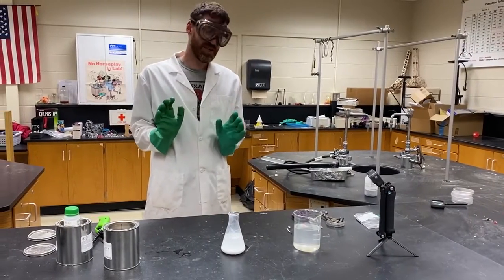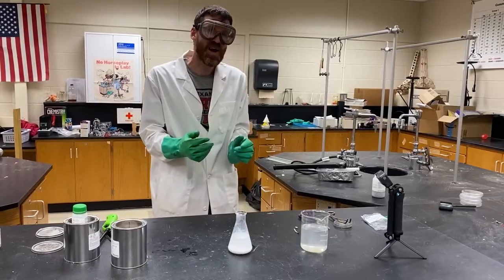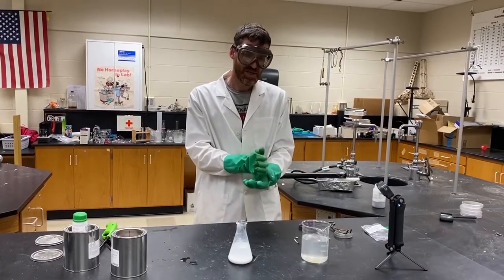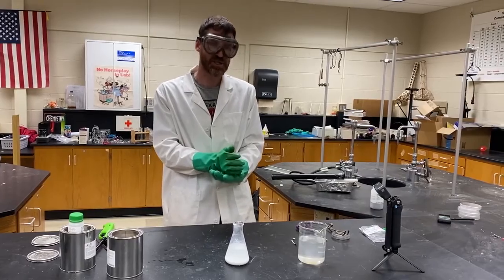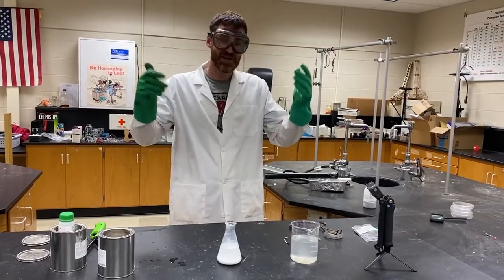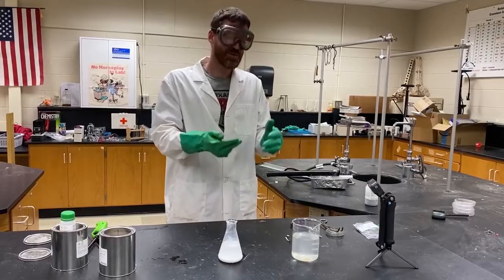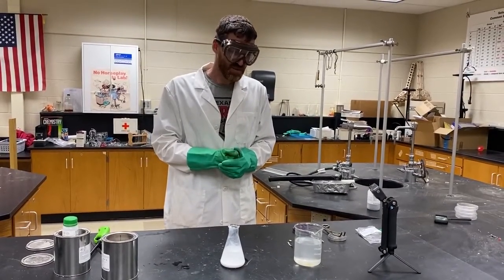It's pretty cool to think that water is causing fire. Boggles the mind. But what is happening? The sodium is reacting with the oxygen in the water, creating hydrogen. The hydrogen is reacting with the oxygen in the air, and with my ignition source, it's burning. It's turning back, it's creating water. So it's just a pretty cool little circle there, that's what's happening with it.